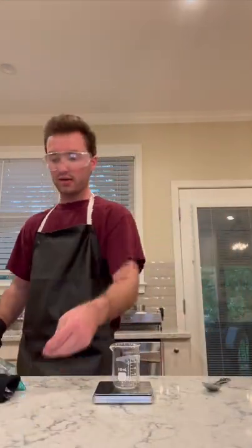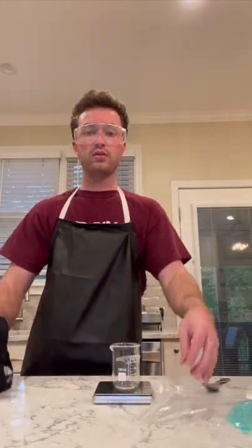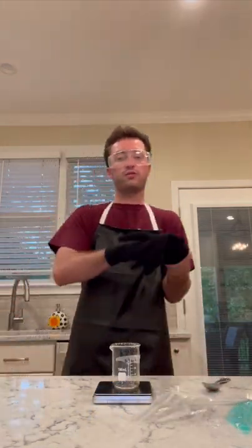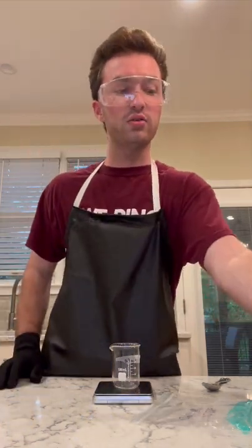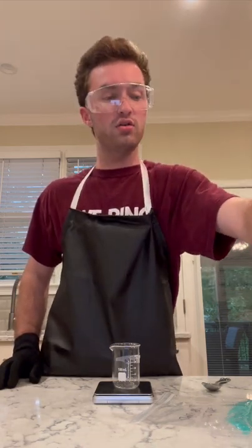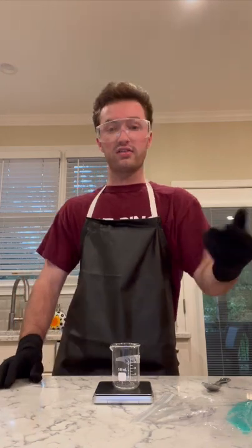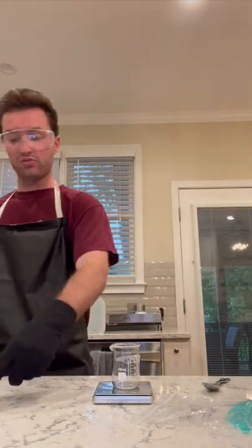Alright, so back again. This time preparing the fourth and final reaction. If you're wondering why there is no video for the third reaction, that is because for the third reaction I need to use some of my HCl from my second reaction. Since that's already been prepared, I don't really need to prepare it again if I'm just using some leftovers.